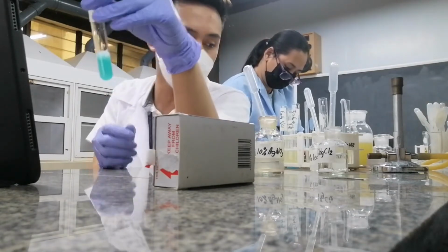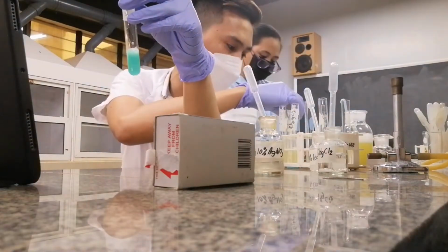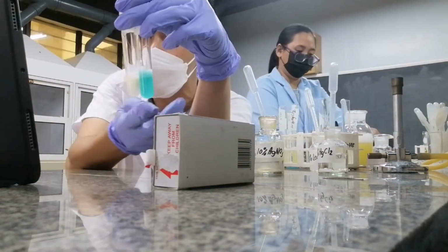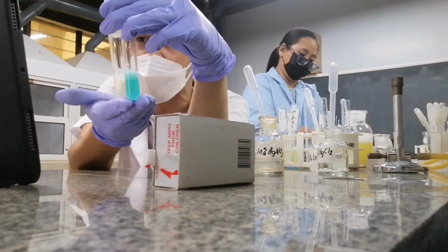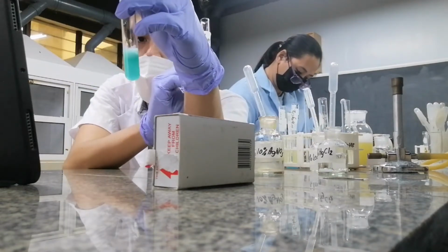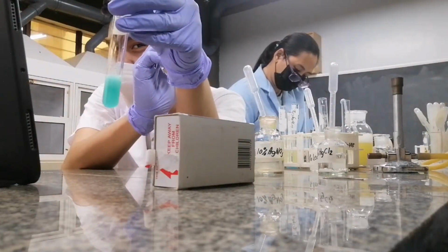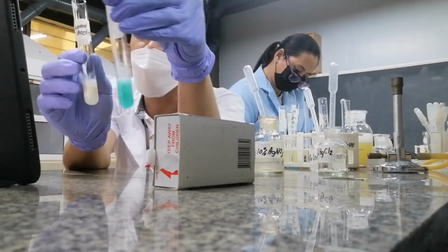So you saw that. The effect of lead and copper is the same, because both of them are actually heavy metals. So you would expect them to have the same effect. So for lead, it's white. For copper, it has a blue tint to it, sometimes green, bluish green. That's actually correct.